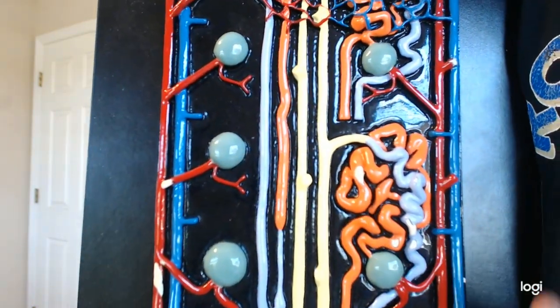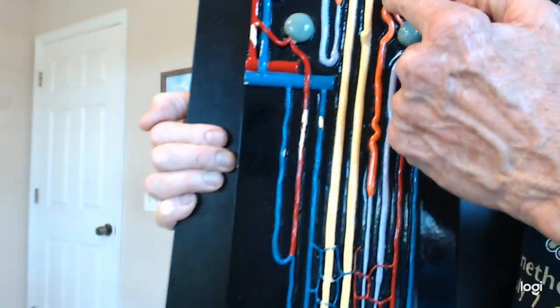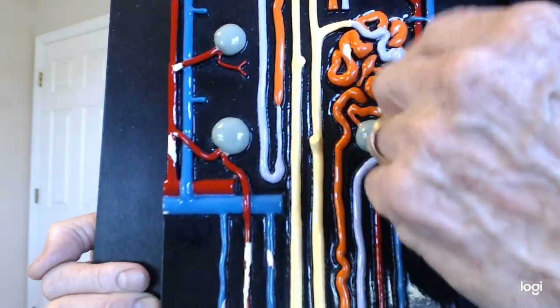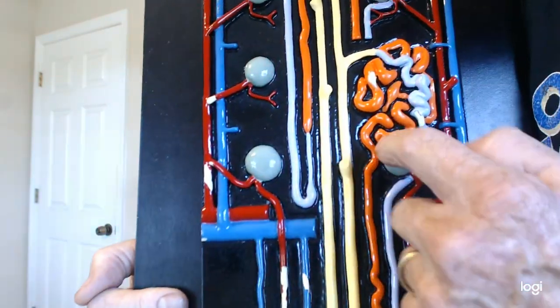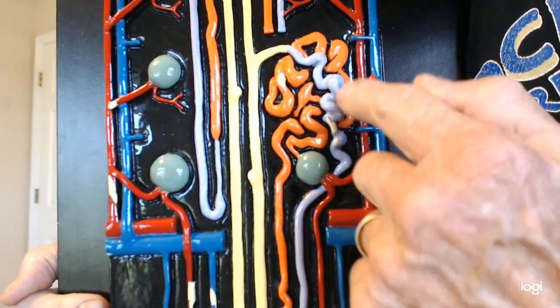So we're going to have a proximal tubule going in. We have the descending loop of Henle, ascending loop of Henle, and then it comes back close to the glomerulus at the macula densa. It becomes the distal tubule, and it dumps into the collecting duct. Okay? Dumps into the collecting duct. See, in this case, it's coming out the top. So descending loop, ascending loop, macula densa is here in this one. Distal tubule is connected to the collecting duct.